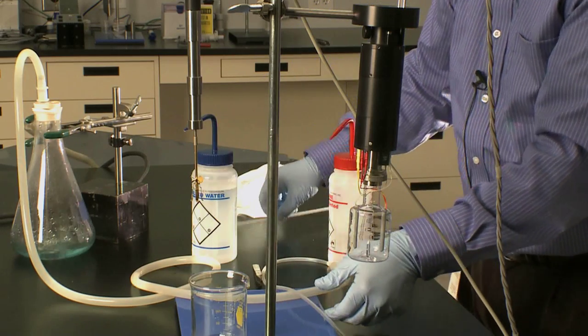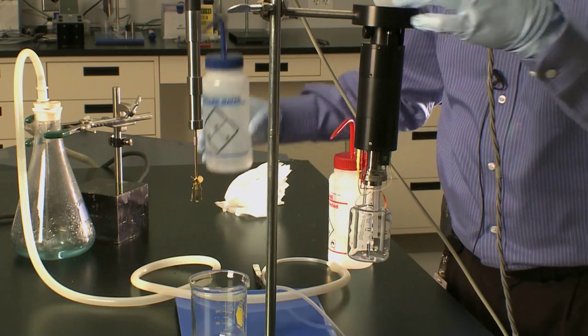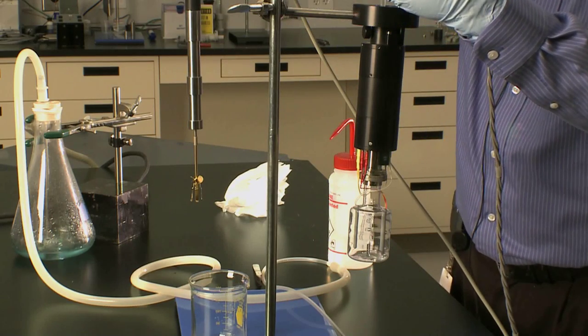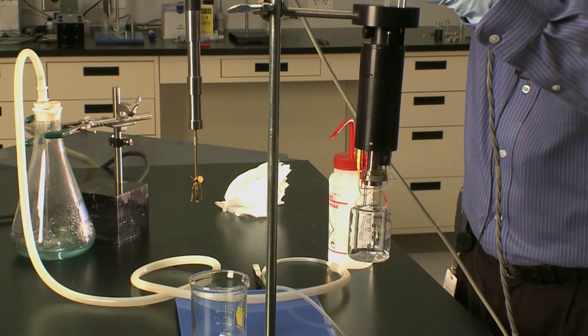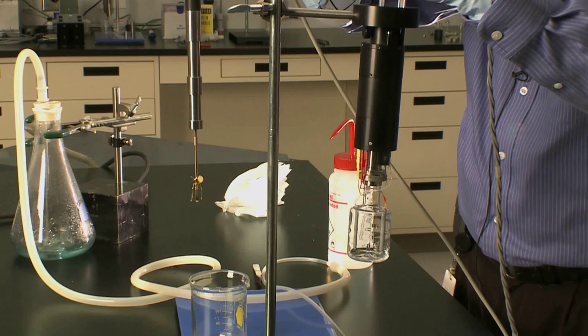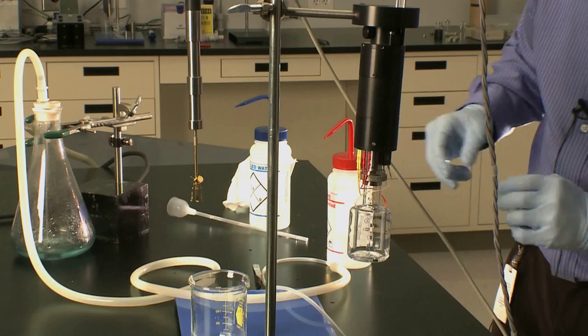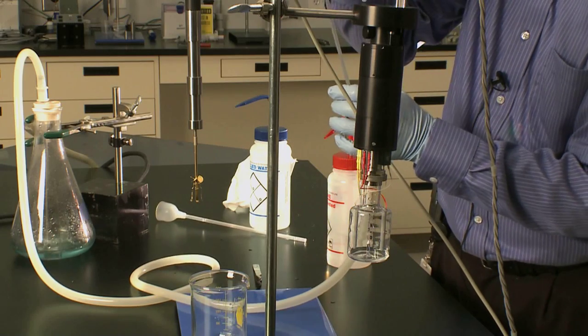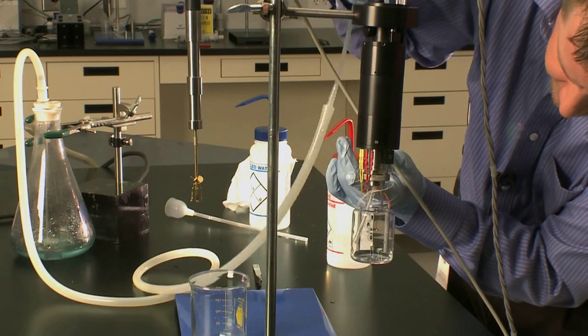With the funnel provided, you can put that down into the vessel and rinse a couple of times with water to clean out the vessel and rinse out any of the solvents that you have in place. You can swirl it around a little, fill it up with more water, and then vacuum the solution out, making sure that you have all the glass pieces.